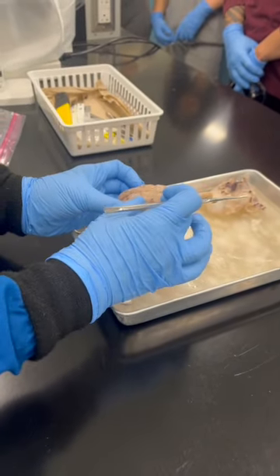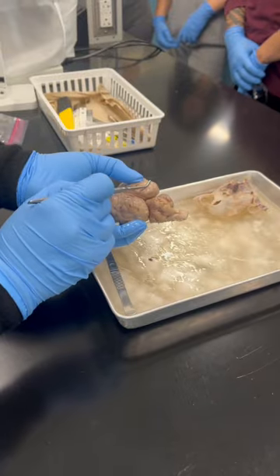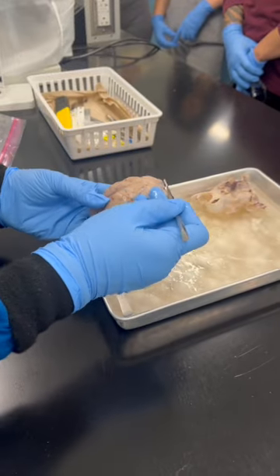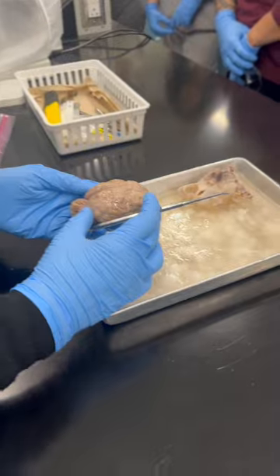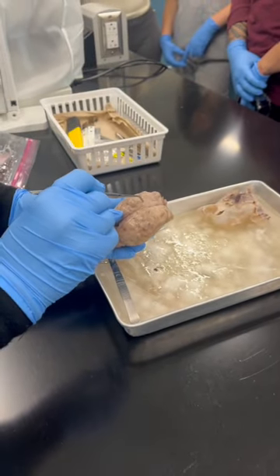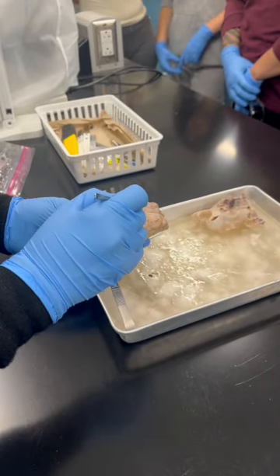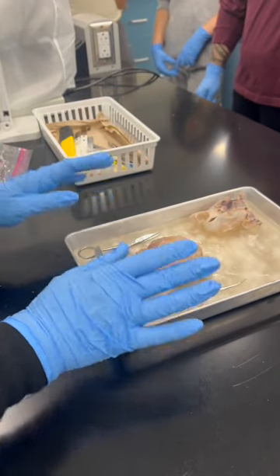This should be the parietal lobe. Then what should this be? Occipital lobe. And both sides are what? Temporal lobe. So the temporal, frontal, parietal and occipital lobes are on the cerebrum. Then also what divides the frontal from the parietal? Central sulcus. So those are the structures. If you have any question, please let me know.